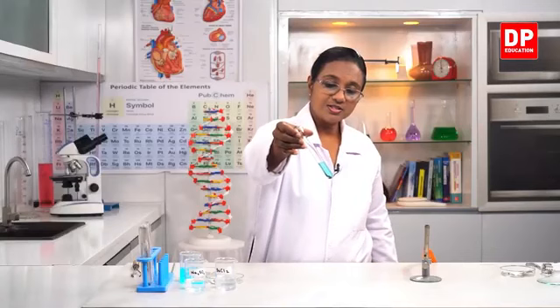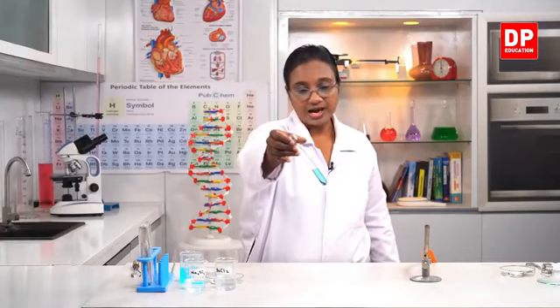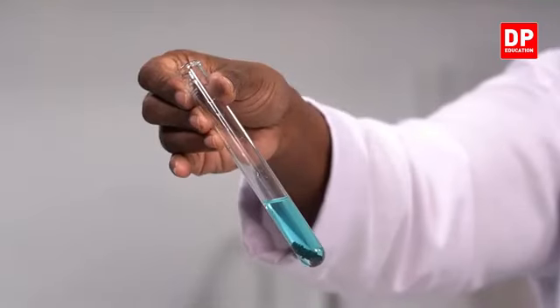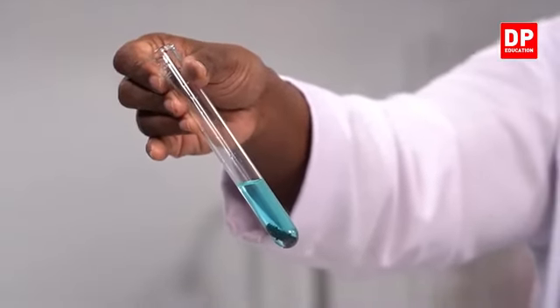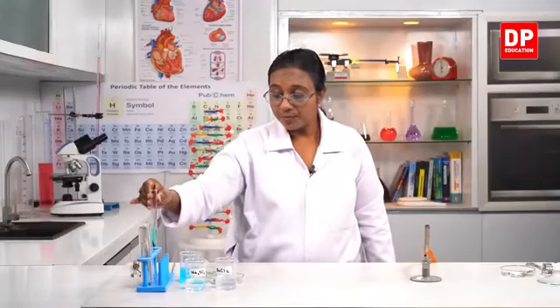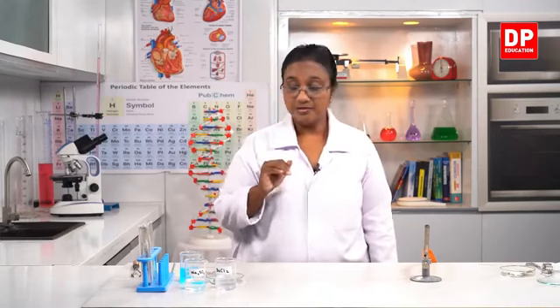Now can you all see, students? The color has become lighter and you can see the brown colored substance deposited at the bottom. So in this reaction where we used copper sulfate and zinc, two reactants, it became zinc sulfate and copper was deposited. So there, copper was displaced by zinc. Therefore, we call that reaction a single displacement reaction.